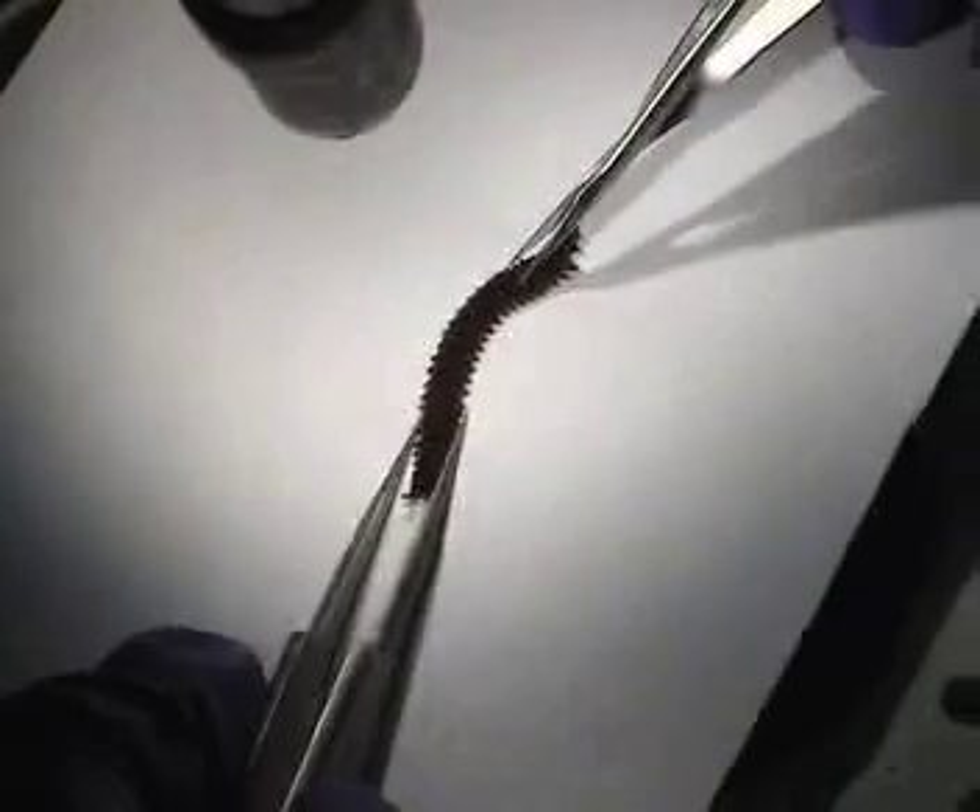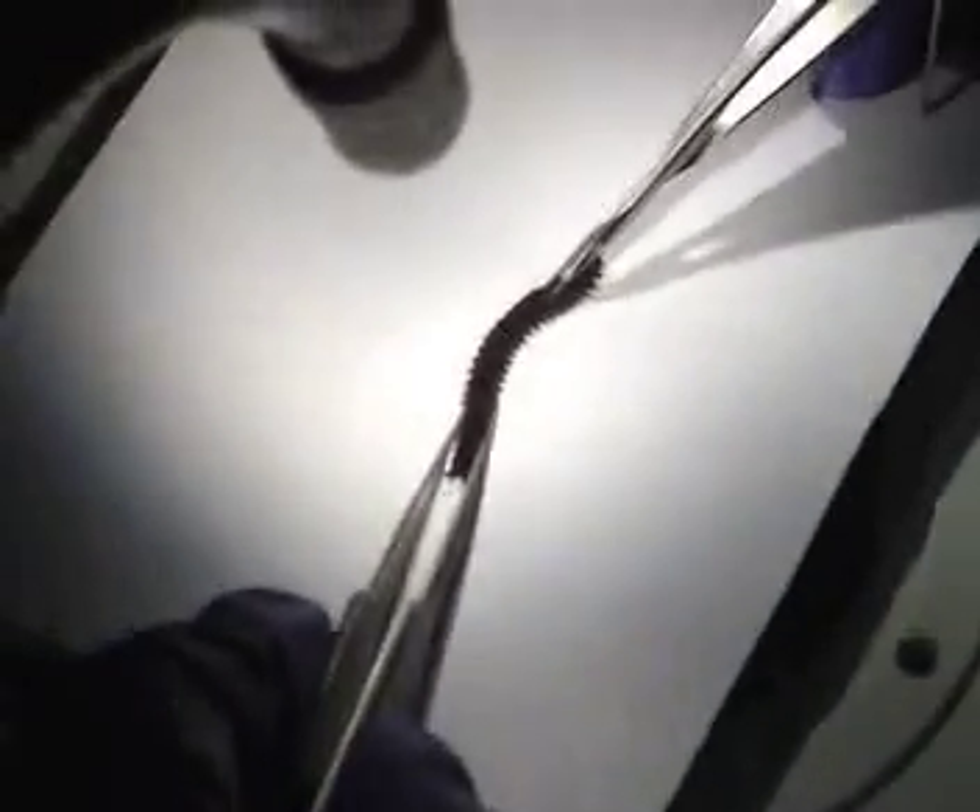Oh, it's like this is how it traps its prey. And now the antennas are gonna fall off — it's gonna rip out the eyes. You could dissect it out from the cloth. I didn't think the slime was this sticky. It's still still — it's not twitching. It's still just squishing it; that's why scissors are better. All right, it's bleeding — or hemocyaning, whatever it does. All right, an incision!